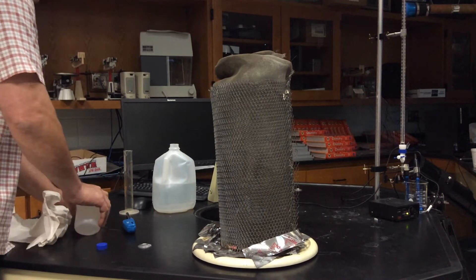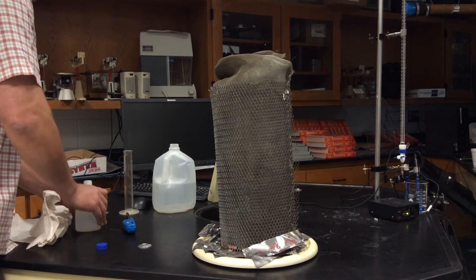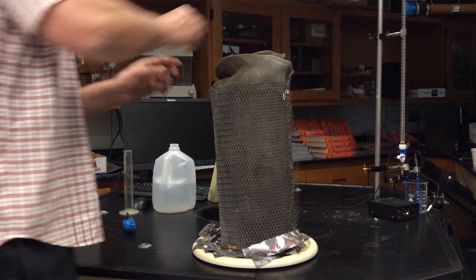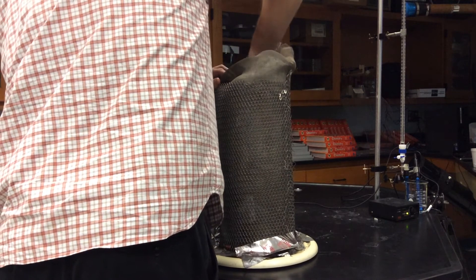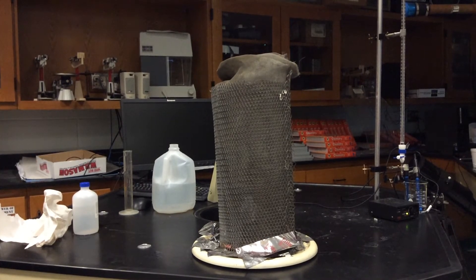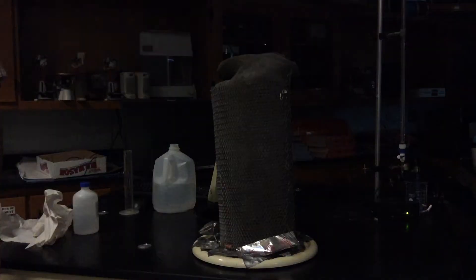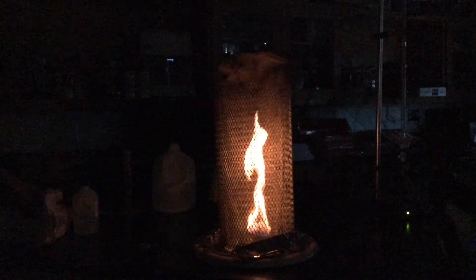So any case, I'm taking some ethanol, which we used in our ping pong demonstration. And I essentially, I am lighting it, I am dousing it in ethanol, which likes to combust. I'm going to put it into this container that's inside. And now I'm going to light it. I don't know, maybe we'll see it. You can shut the lights off. Here, I'll shut them off. Lily's got it. Okay, I see nothing. Okay, so let me light this up without lighting myself up. Okay. Okay, now, so there's my flame. Let it calm down. Okay. And what I'm going to do is I'm going to spin this. I'm going to change the pressure around a fire. So there's my fire.